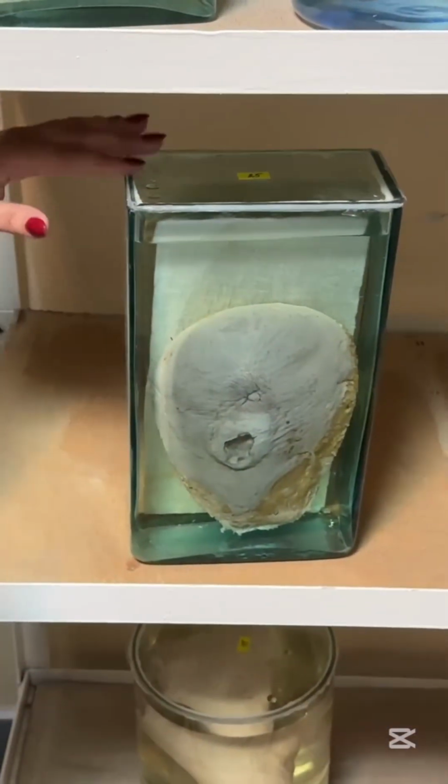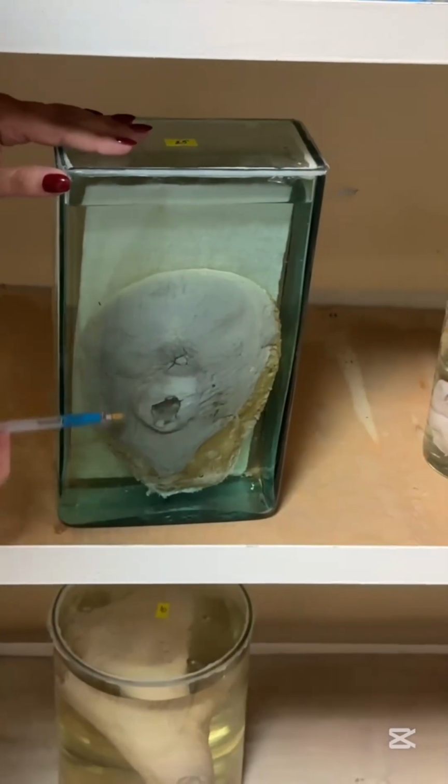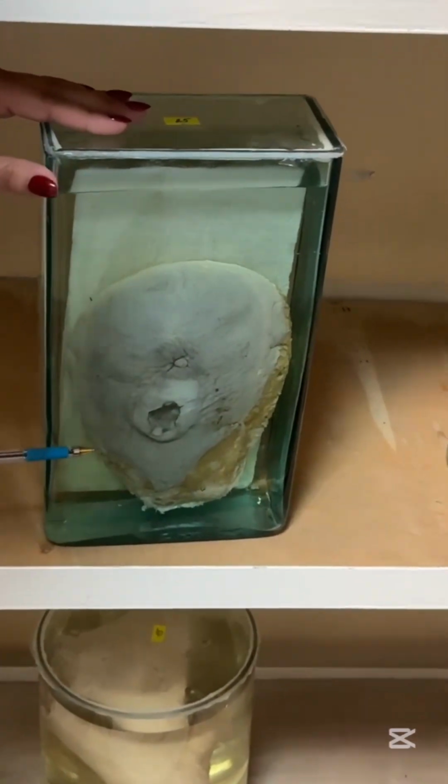Breast carcinoma, you saw it last week, not difficult, large tumor with invasive growth, malignant, and focus of secondary necrosis in the middle. That's why cavity.